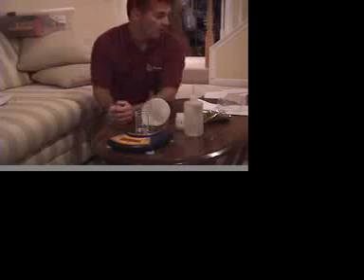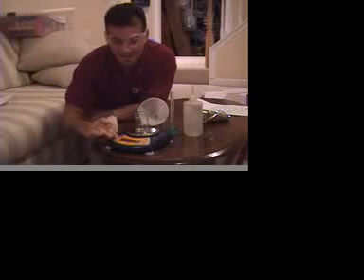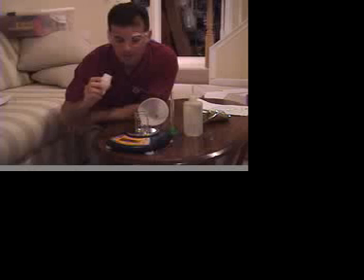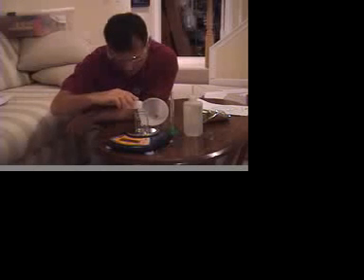This lab said to weigh a random sample of tin more than 10 grams but less than 25, okay? So this is what we mean by random. Before we get going, let me put my safety goggles on just in case anything explodes. That's not going to happen. I'm just kind of teasing you. So, make sure we're zeroed properly. Good. And just going to add some tin until we get between 10 and 25.